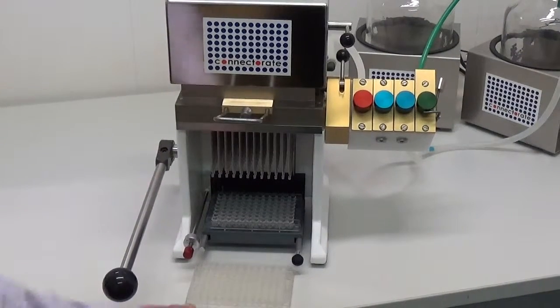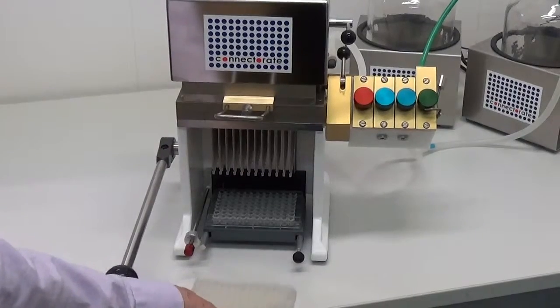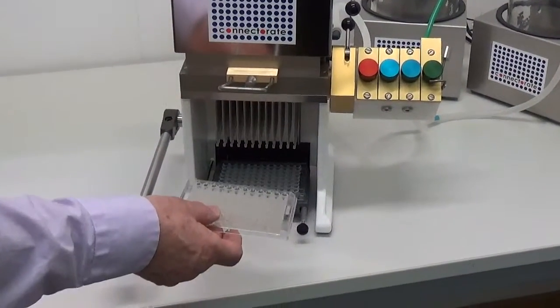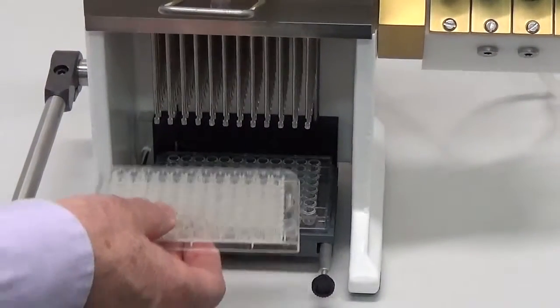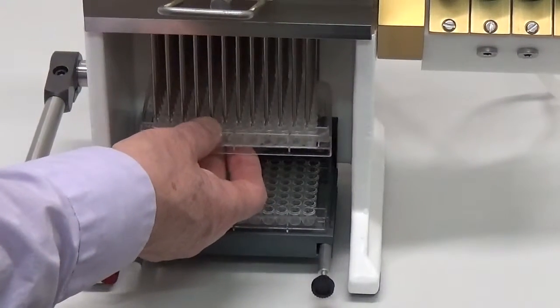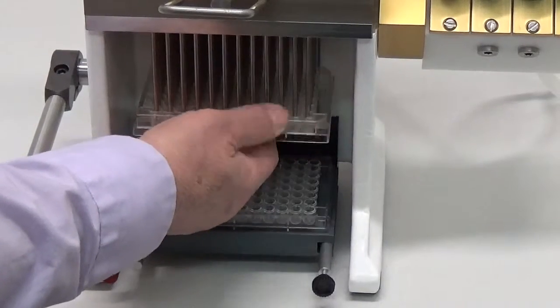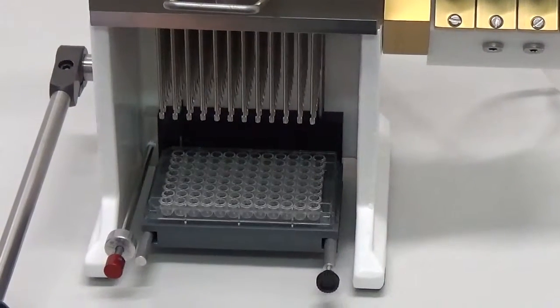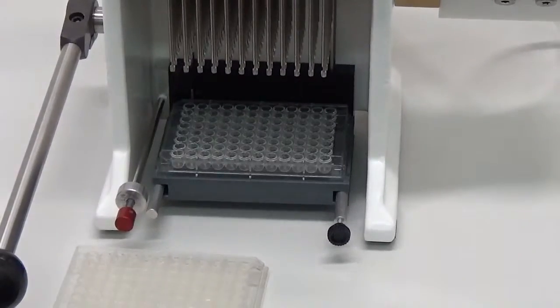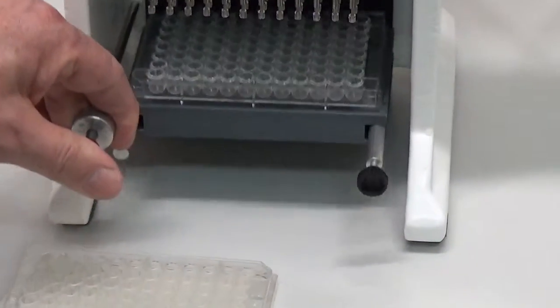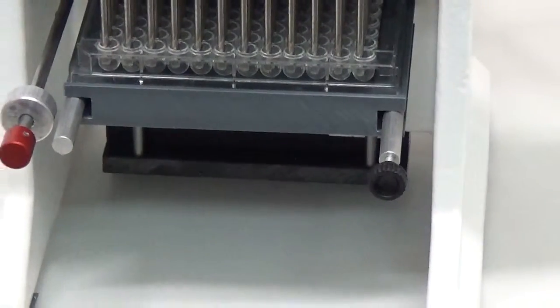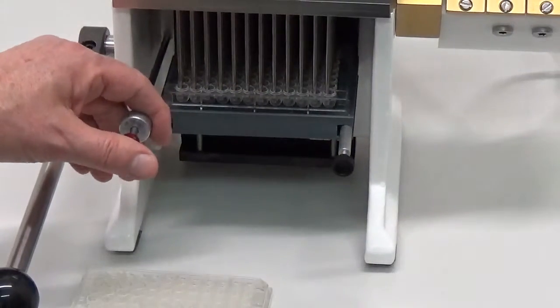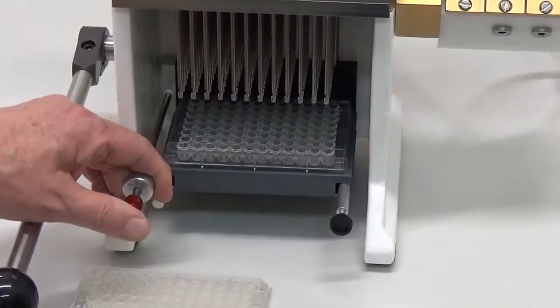The sample plate can now be lifted to the aspiration tubes by hand or by the plate lift. Lifting is possible by pressing on the red button.